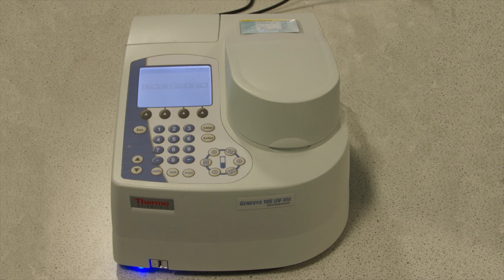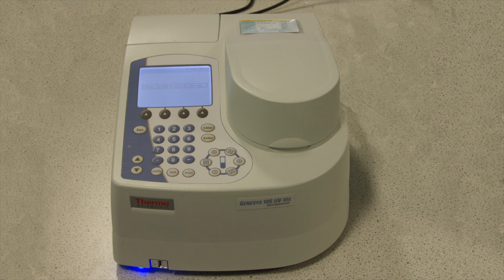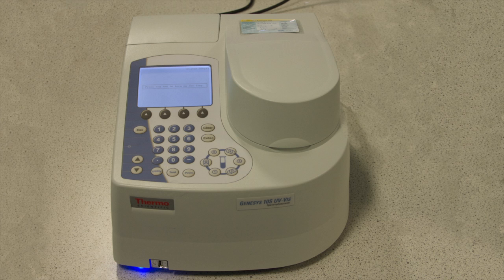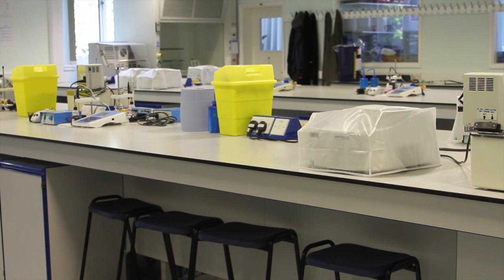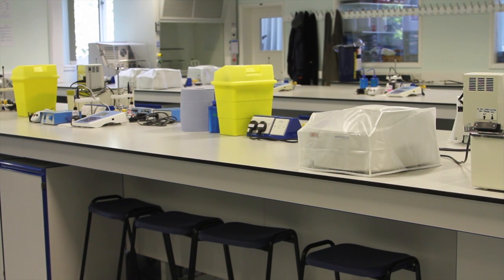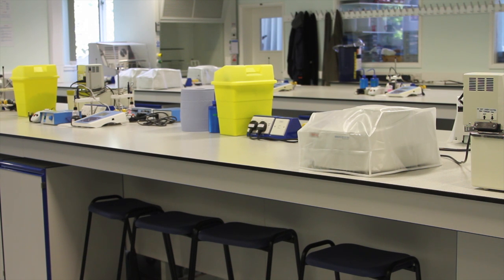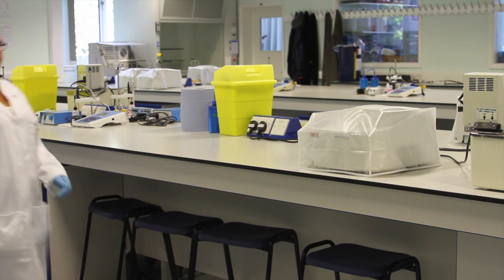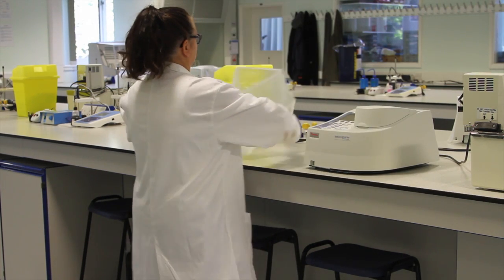In simple terms, the result can be displayed in two ways. Firstly, as transmission — the amount of incident light that passes through the solution — or more commonly, as absorbance, the amount of light that is absorbed by the solution. It should be obvious that more light will be absorbed by a more concentrated solution. Therefore, this is a simple yet powerful technique to determine the concentration of a solution from its absorbance.